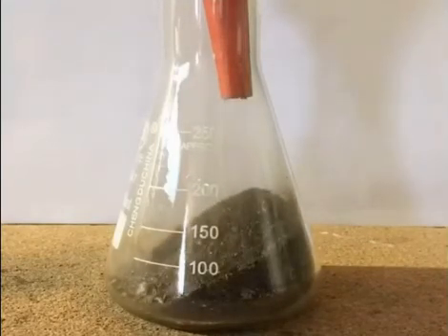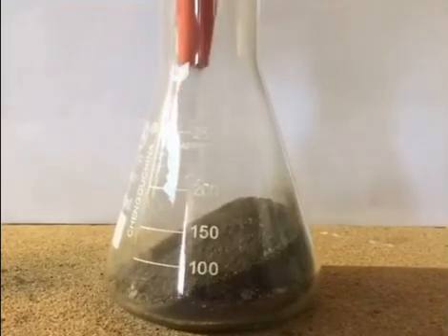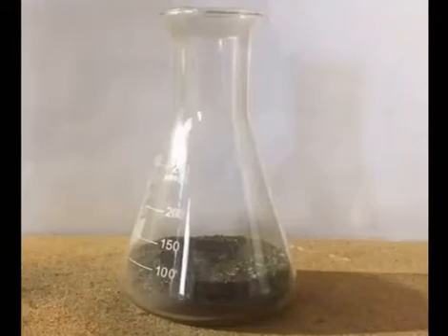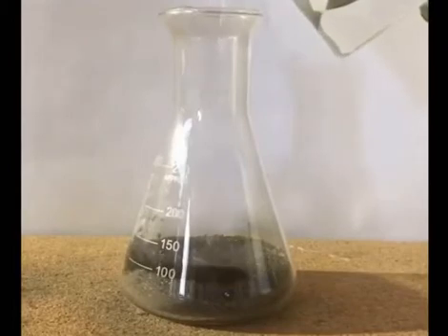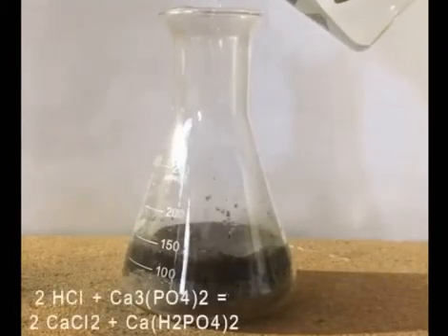To do this, I put the bones in a mild charcoal fire for a few hours. Now, 26 milliliters of 32% hydrochloric acid are diluted in 125 milliliters of water and added to the flask.